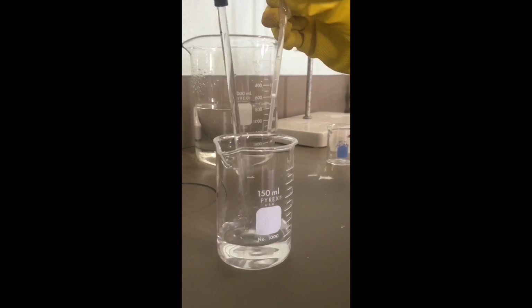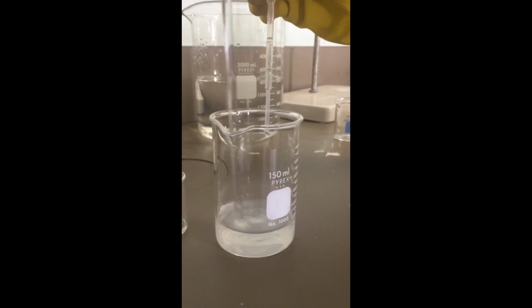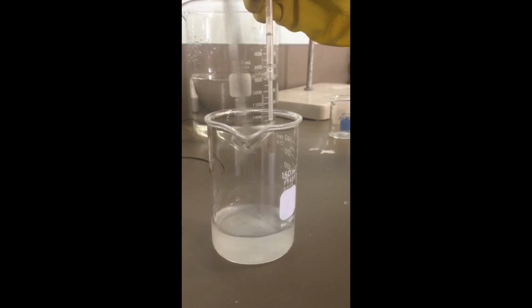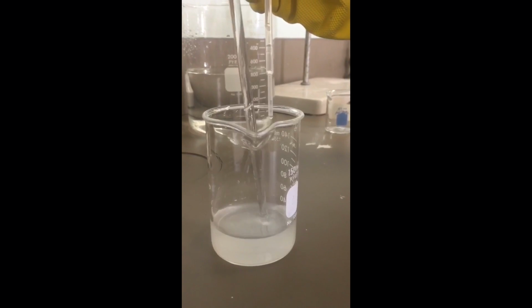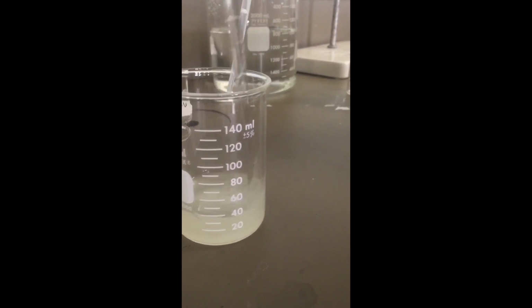So it looks like spooky. So the lights flicker a little. Okay, wait. It's not working. It says concentrated ammonium hydroxide dropwise to silver nitrate in the beaker until gray-black silver forms. Yeah, but there's no... How's it going to become gray also?